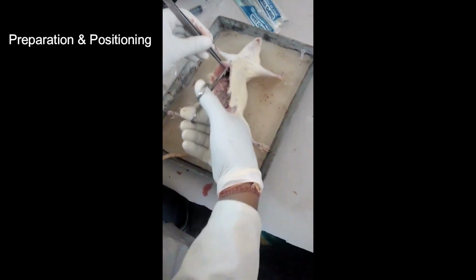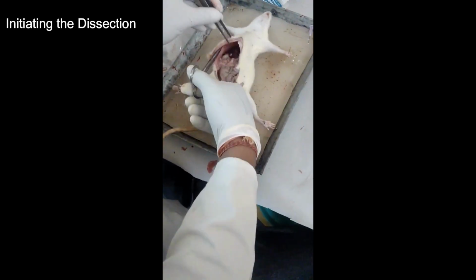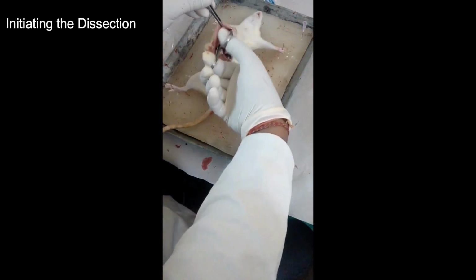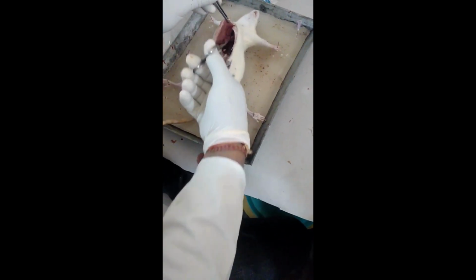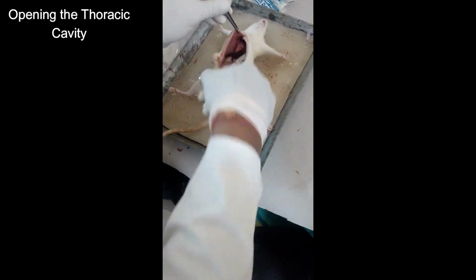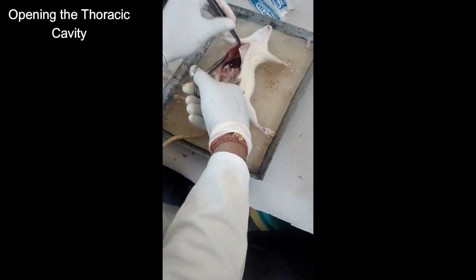Place the rat in supine position on its back on the dissection box. Using dissection pins, carefully secure all four limbs. Stretch each leg outwards gently and pin it through the paws to stabilize the body. This ensures clear visibility and proper control during the dissection.